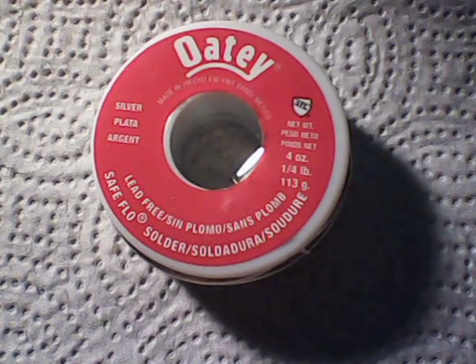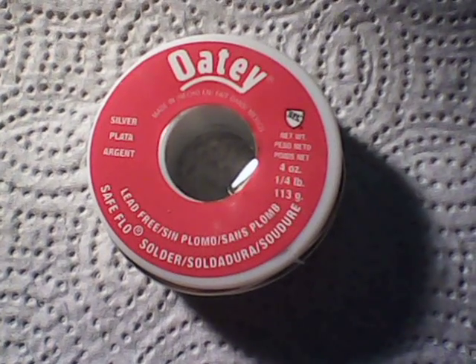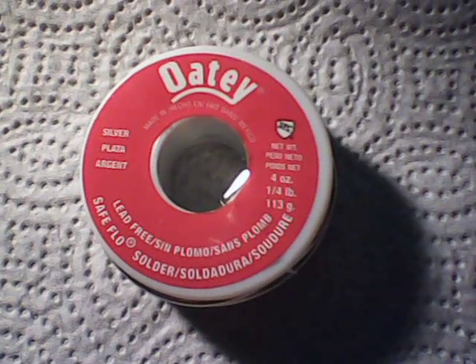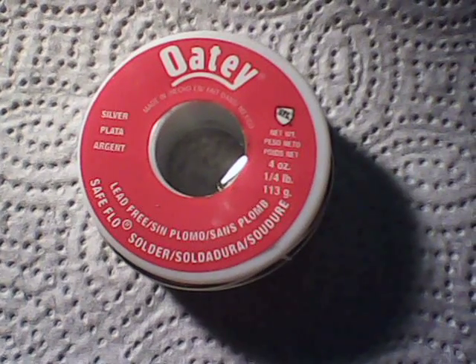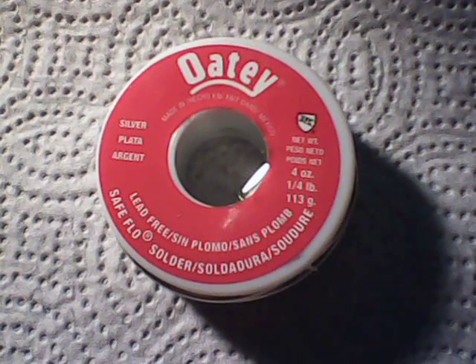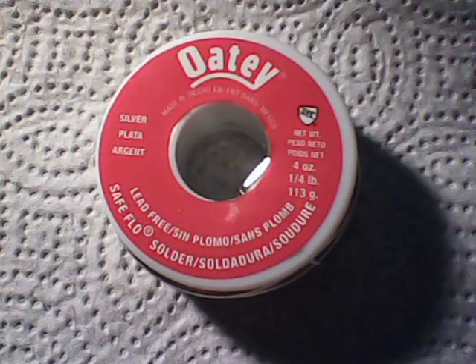After that, I'm going to incinerate or melt it, then digest it in nitric acid and see if I can cement the silver out — and hopefully leave the antimony behind. I'm not sure if the antimony will dissolve in either acid, or whether it will cement out with the copper. The only way to know is to do this and see what happens. I may also have to run it through an electrolytic cell to refine it further. But that's why they call it experimenting.